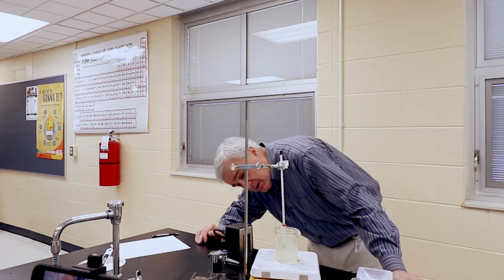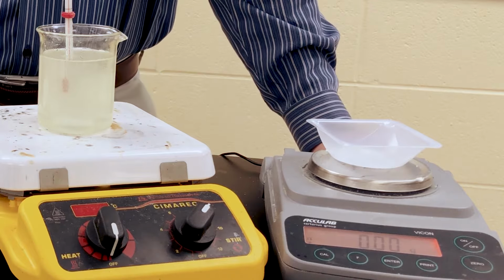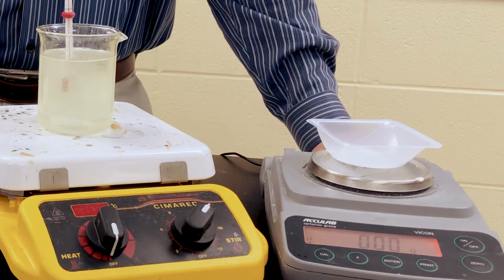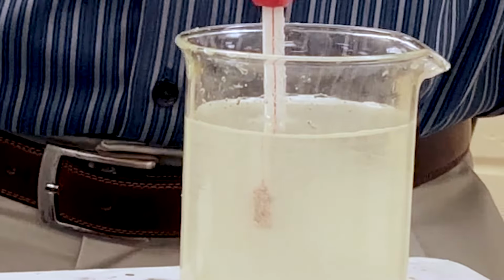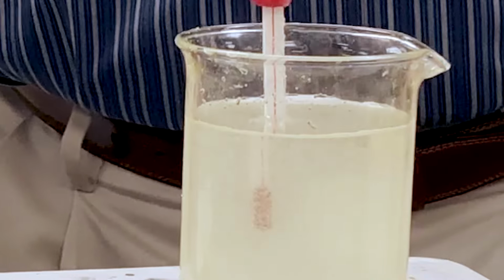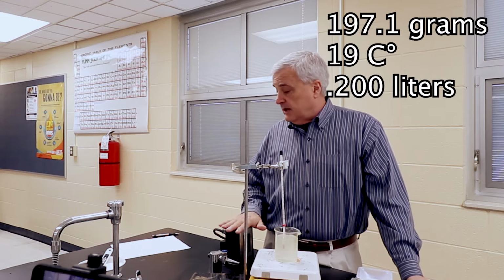And I'm just feeling like maybe if I let it stir for a lot longer, I could get more to dissolve. But I feel like I've waited a really long time to get the last to dissolve. So we're going to say we are saturated at 19 degrees, 197.1 grams of sugar.